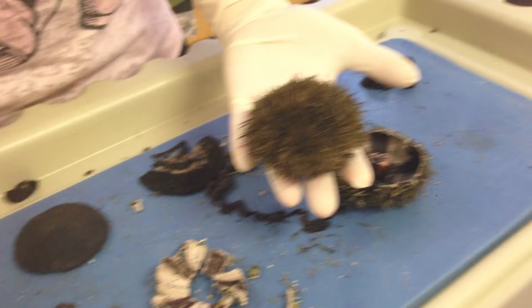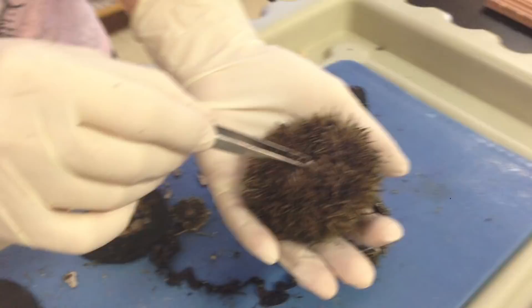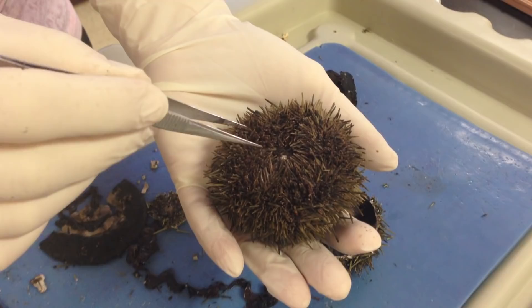When you're getting ready to dissect your urchin, you want to make sure you note the two different sides. The ab-oral side, and you can flip it over, and this is the oral side. If you look down inside, you can actually see the white structure, and those are going to be the teeth of Aristotle's lantern. This area right here is called the peristome — this is going to be where the mouth is, so it's the area around the mouth.